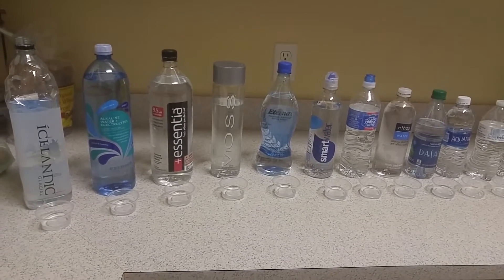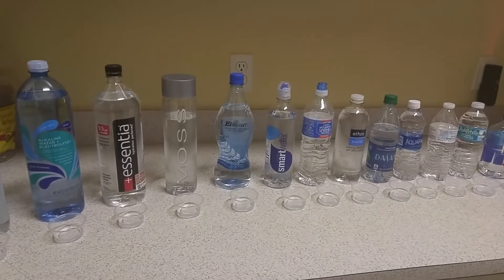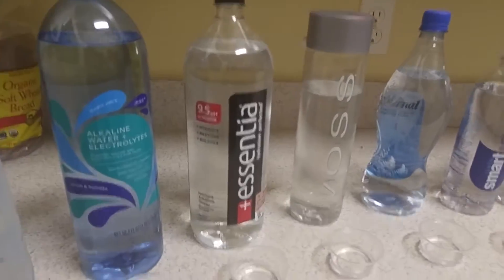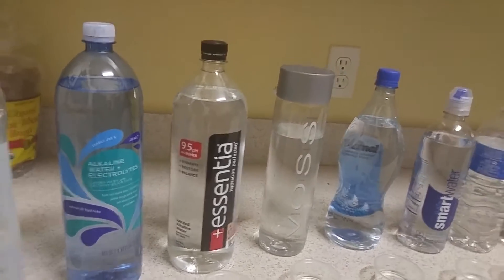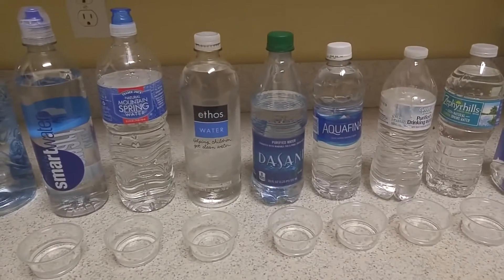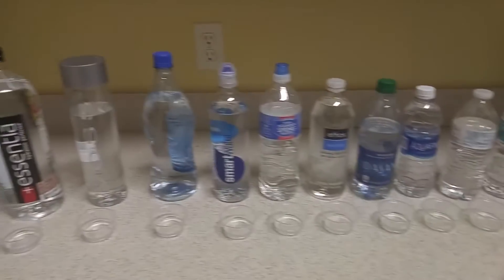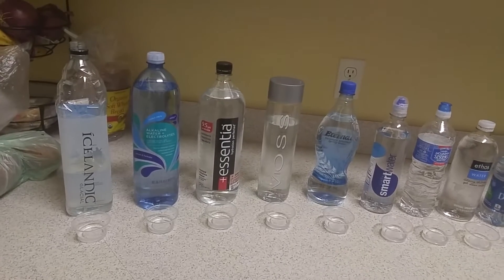The point of this video is we've bought a bunch of bottled waters and we're going to try them out to figure out what their pH level actually is in each of these bottles. Some of them are advertised as having a higher pH than normal, like Essentia with a 9.5, and others are just normal everyday waters — Starbucks, Trader Joe's brand, Zephyr Hills, Great Value (Walmart brand), Fiji, and tap water. We're going to see exactly what their pH levels actually are.